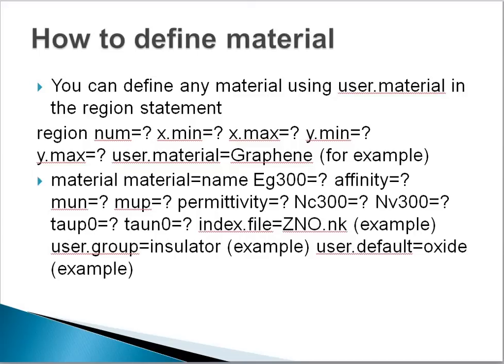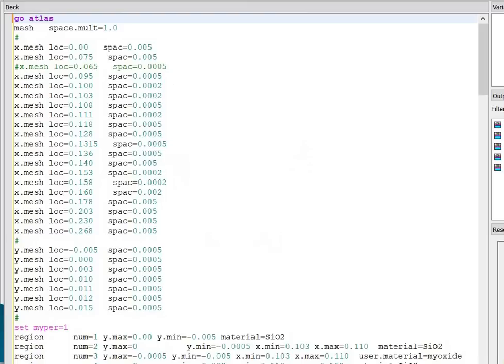Next, you have to define the band gap, e.g. at room temperature. Next, define the affinity of the proposed material. Next, define the mobility of electron and hole of the proposed material. Next, if the material is an oxide, you have to define the permittivity. Next, define the density of states for electrons as well as holes. Next, define TAUP and TAUN. Next, you can call any index file, for example ZNO. Next, you have to define user.group. The proposed material will belong to which group, meaning either it will be an insulator or semiconductor material. If the user.group is insulator, you have to use user.default, as it is an oxide material. Let's go to the code.